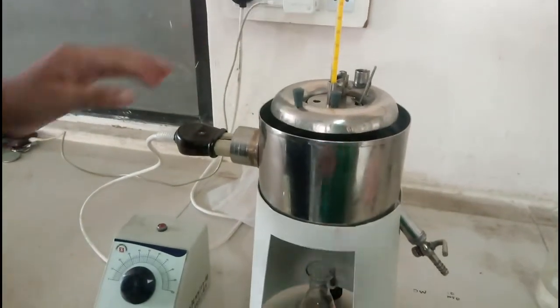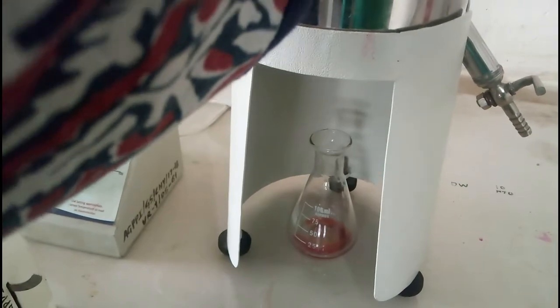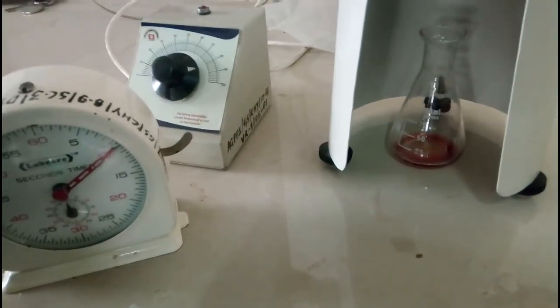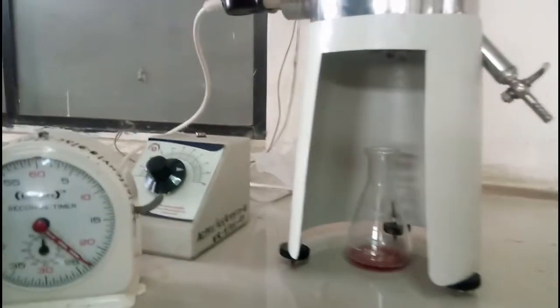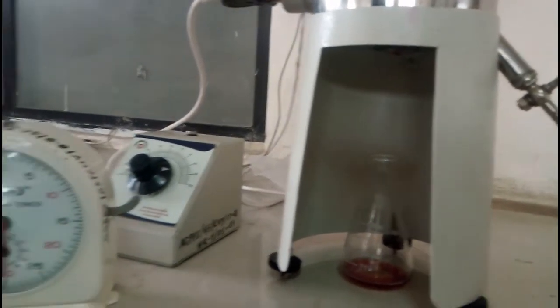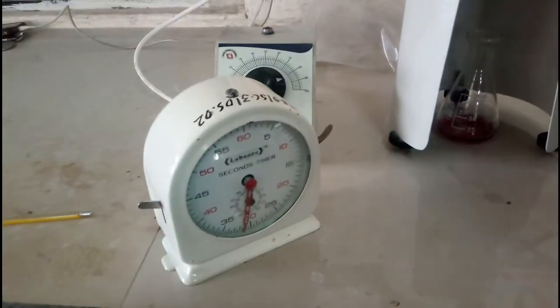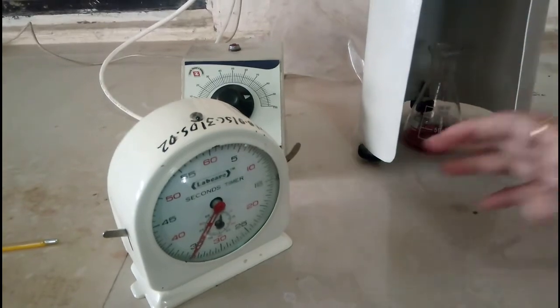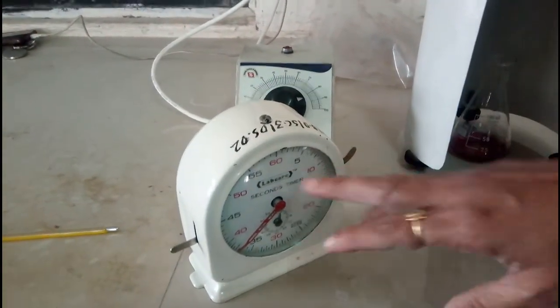Now we are going to stop the heating. What we have to do: we have to remove this ball and record the time — how much time it is taking. I am going to remove the ball and switch on the stopwatch simultaneously. Here is the conical flask — you have to keep it exactly below that jet so we do not waste the oil. Now all the liquid has come out from the inner cup. We have to stop the stopwatch. You have to record the reading.